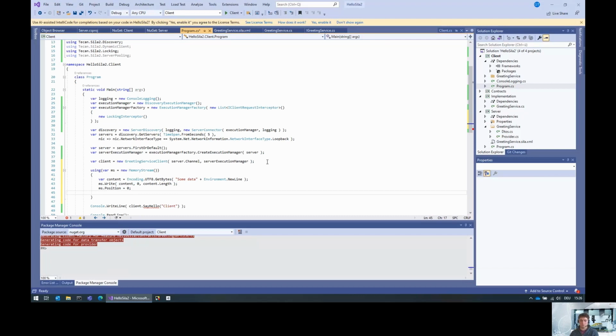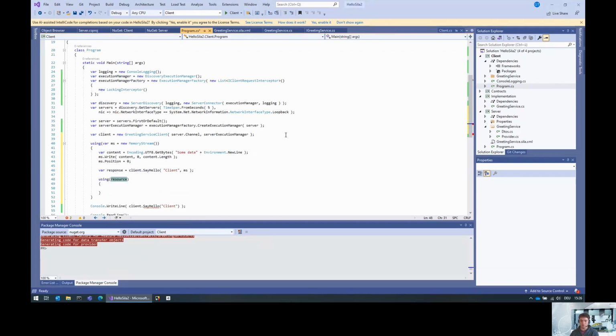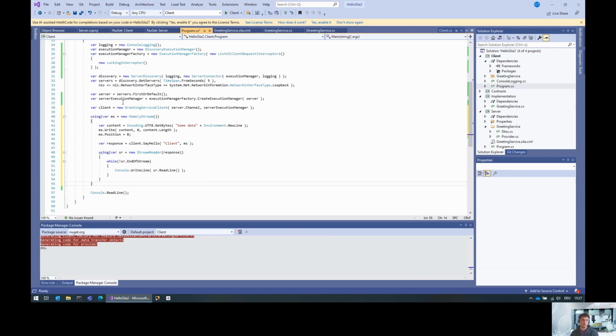And then we set the position of the memory stream. And then what we do is we get the response. That will be client.SayHello. And then we pass in the memory stream. And then we can use a stream reader on the response and say, okay, while the stream reader is not at the end of the stream, we do a console write line. Okay, so we basically dump the contents of that stream to the console. And also I'm going to set a breakpoint here to see what the response is.